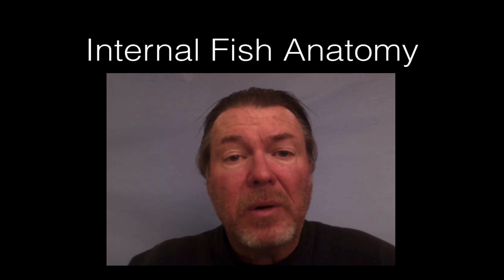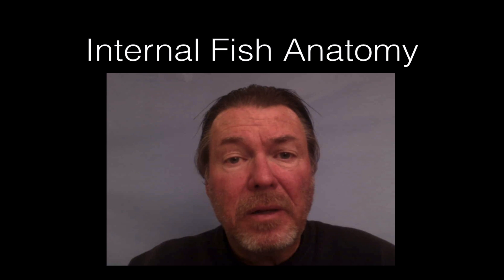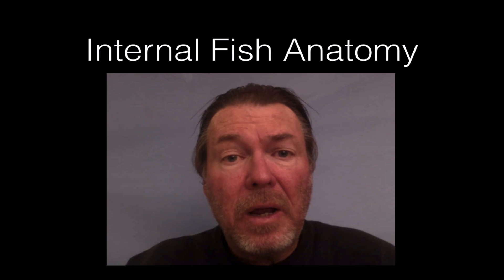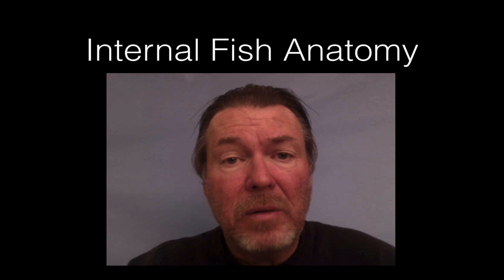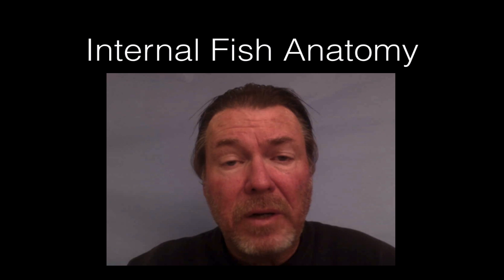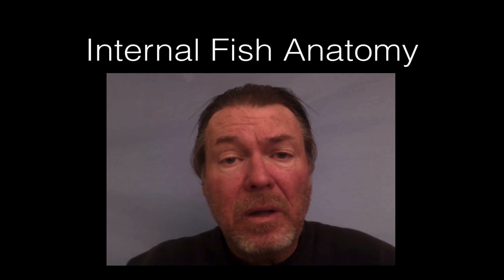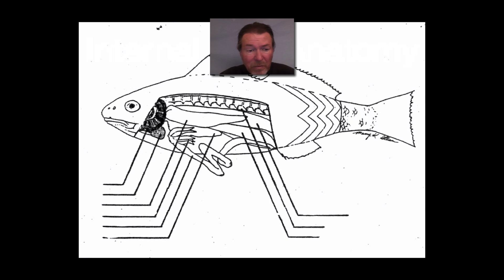Hi, this is Mr. Williamson. I'm going to go over the internal fish anatomy in this video. You probably should have your list of terms with you and your diagrams to go over with. I'm going to show you both the diagram and on the fish what to look for and what you need to know.